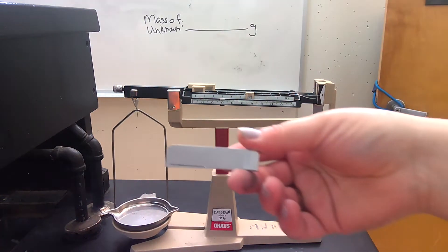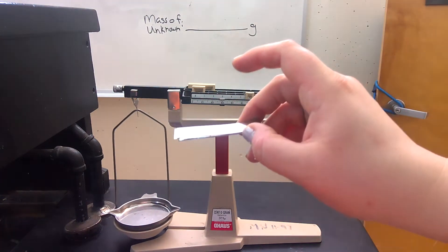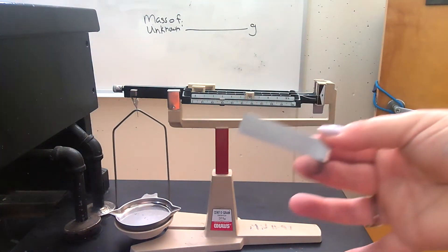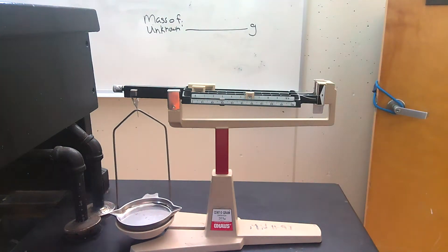So here is our metal that was found at the scene of the crime. This is broken off from something. We're going to try to figure out exactly what this metal is and then hopefully by identifying the metal type, we can link it to the culprit and narrow down our suspects from our suspect list in the police report.